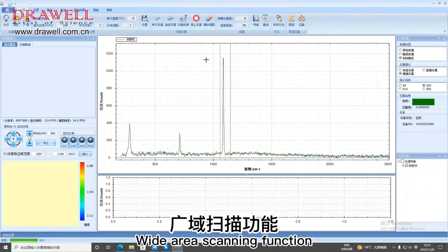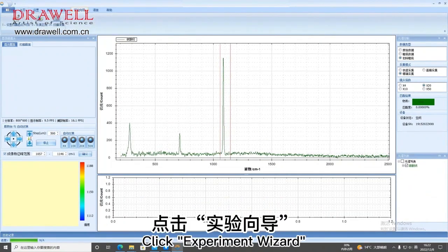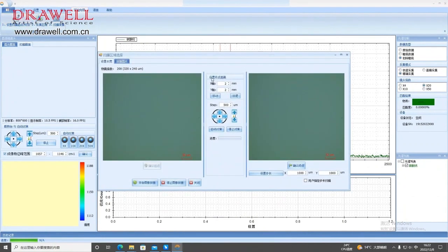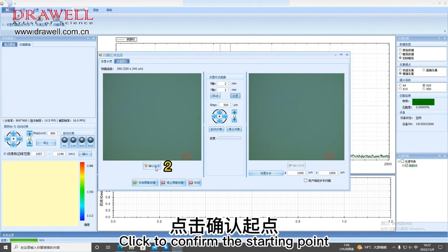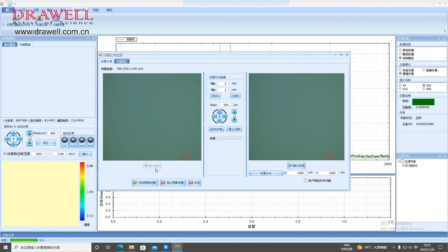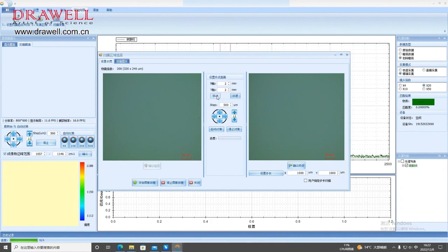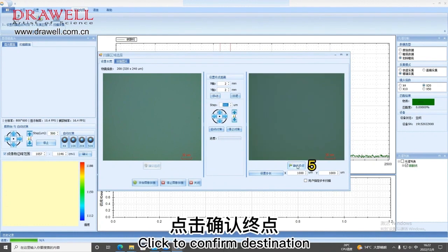Wide area scanning function. Click Experiment Wizard. Set the scanning start and end point. Click Back. Click to confirm the starting point. Modify the X, Y axis parameters. Click to move. Click to confirm the destination.